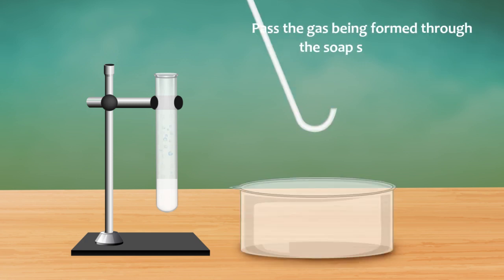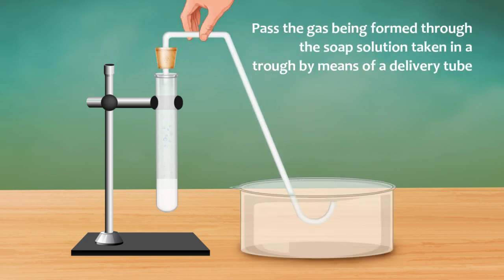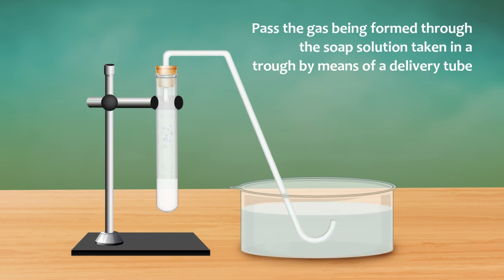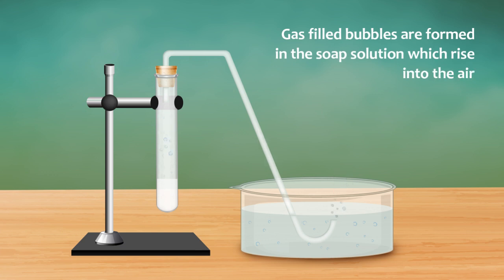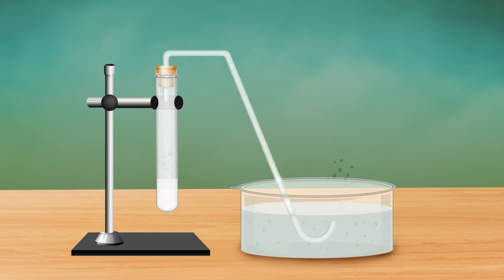Pass the gas being formed through the soap solution taken in a trough by means of a delivery tube. Gas-filled bubbles are formed in the solution which rise into the air.